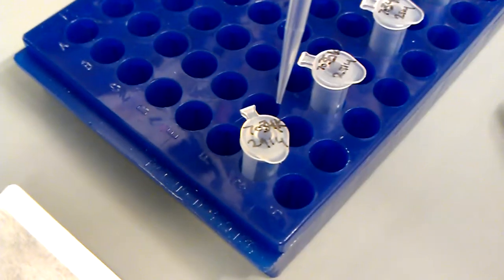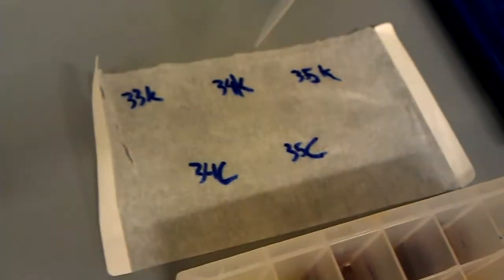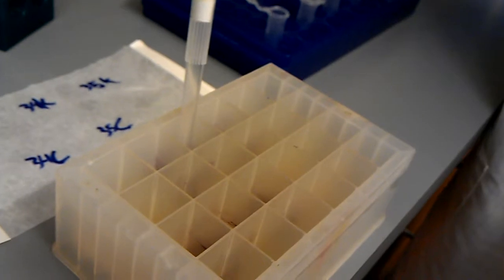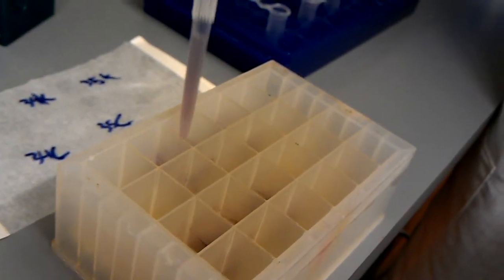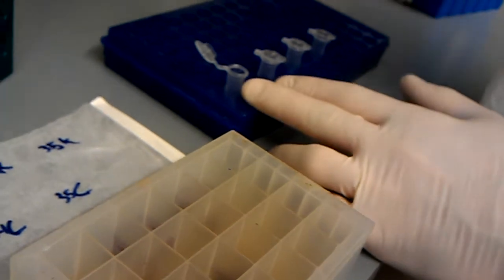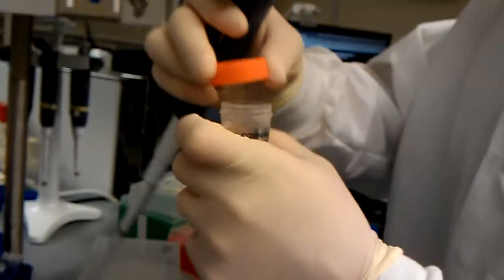So I have four pre-labeled tubes. We have 7034K, which is going to match up with 7034K, which is that sample. So I'm just going to pull up 7034K. We have a nice purple culture in my pipette tip. Eject. Get a new tip and mix it up with some 50% glycerol.